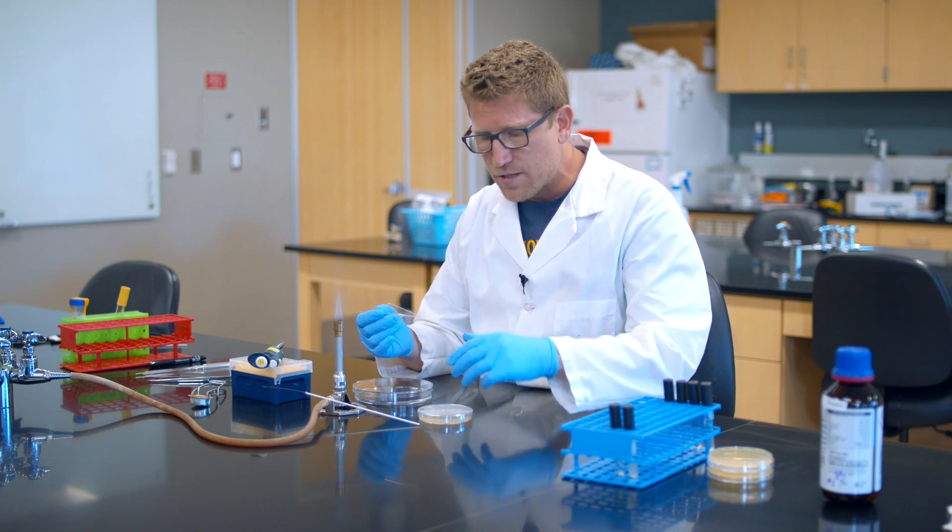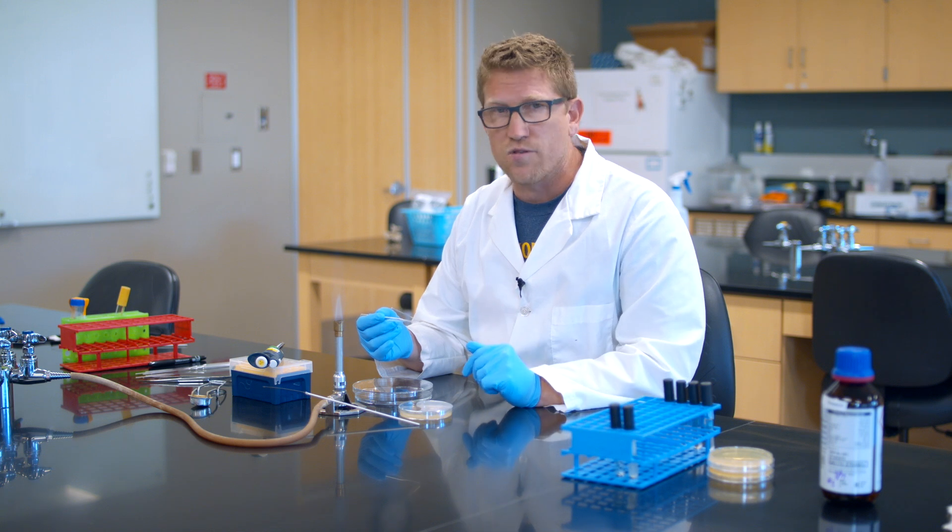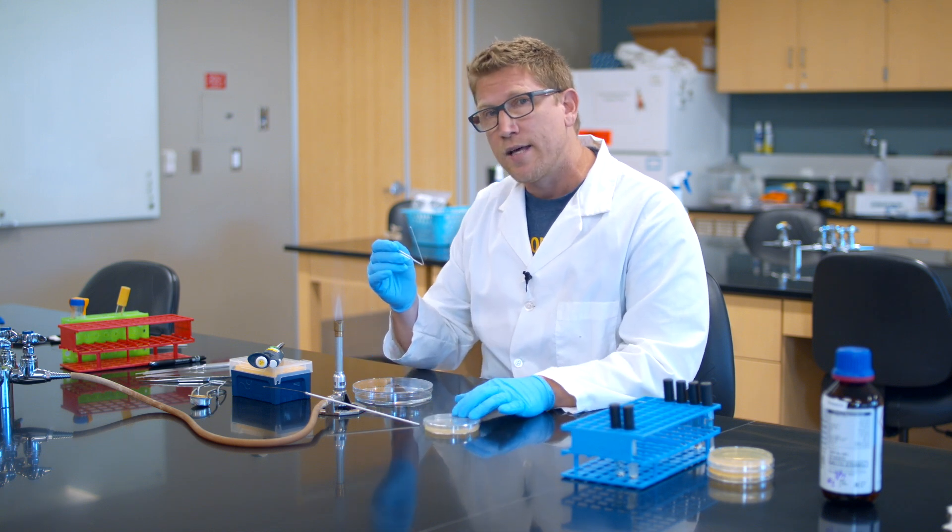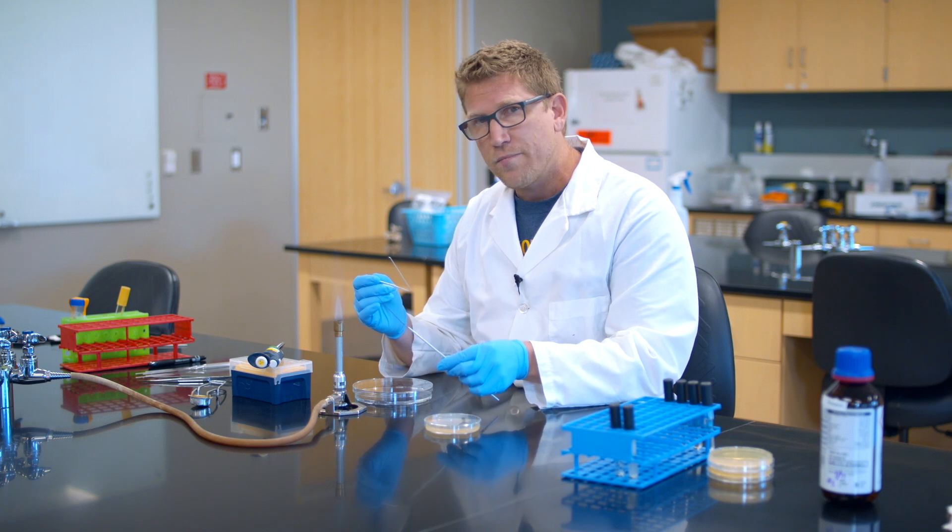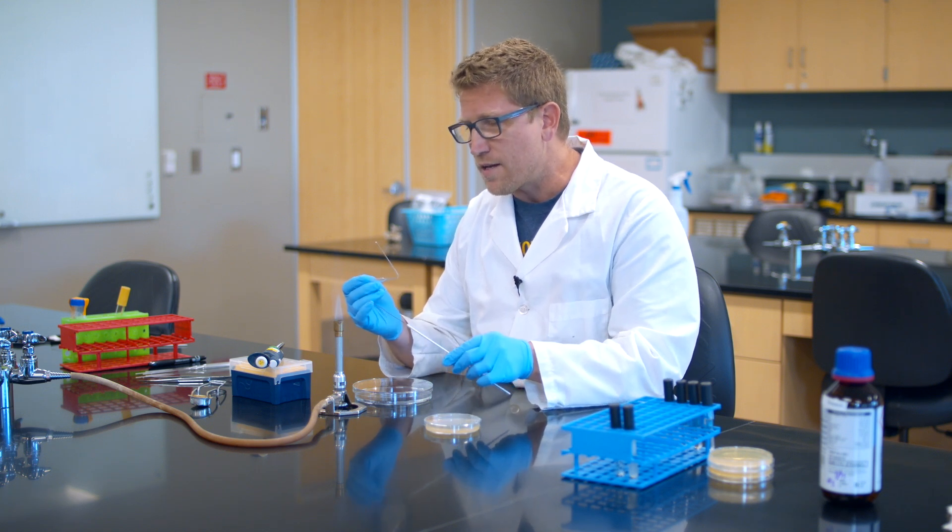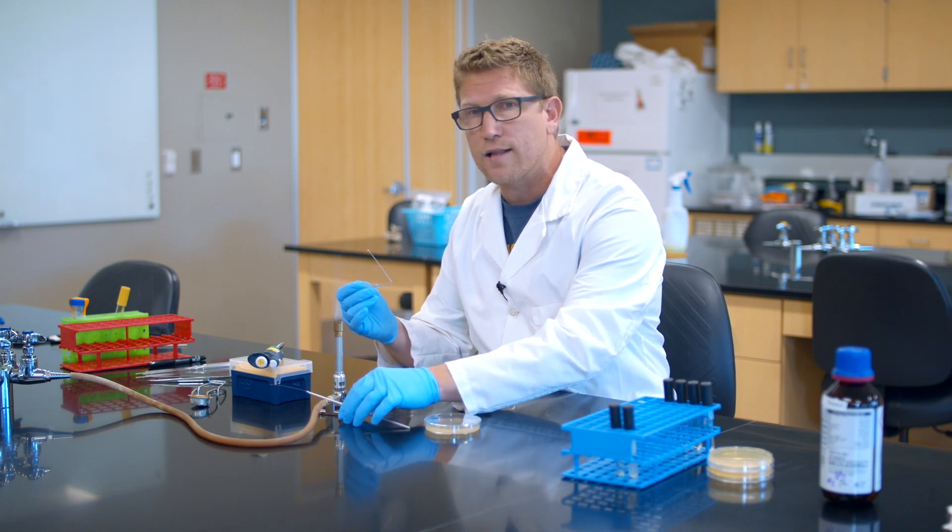If I rub this all over my petri dish, I'm going to get molds and all kinds of weird things growing. So I've got to be able to sterilize this somehow. But unlike my loop, this thing as you just saw is going to melt if I stick it in the flame directly and heat it up.